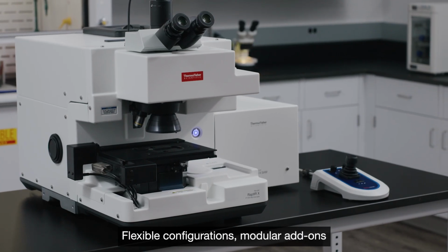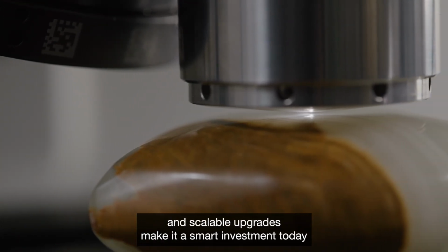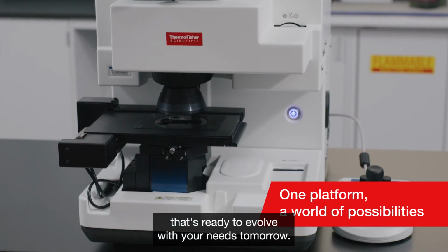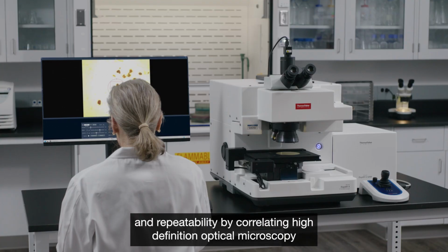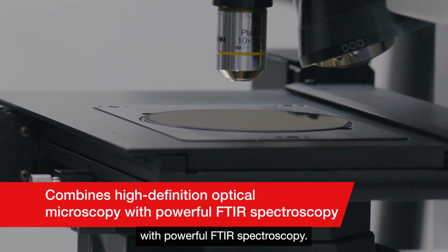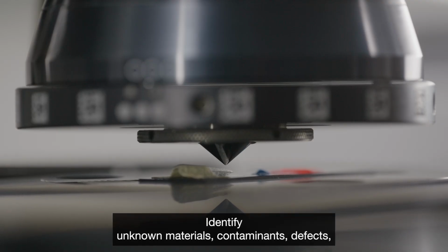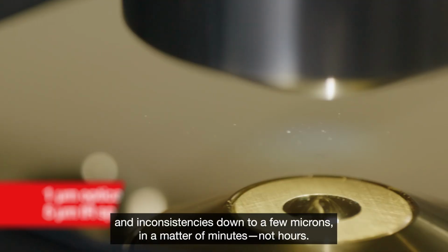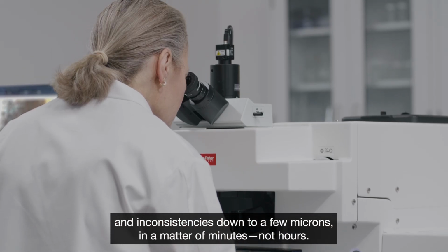Flexible configurations, modular add-ons, and scalable upgrades make it a smart investment today that's ready to evolve with your needs tomorrow. The Nicolet RaptIR combines speed with precision and repeatability by correlating high-definition optical microscopy with powerful FTIR spectroscopy. Identify unknown materials, contaminants, defects, and inconsistencies down to a few microns in a matter of minutes, not hours.